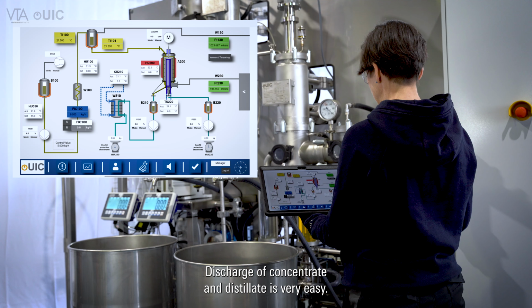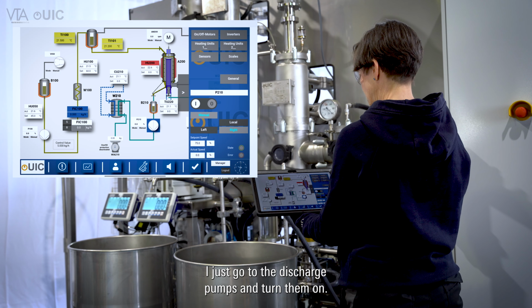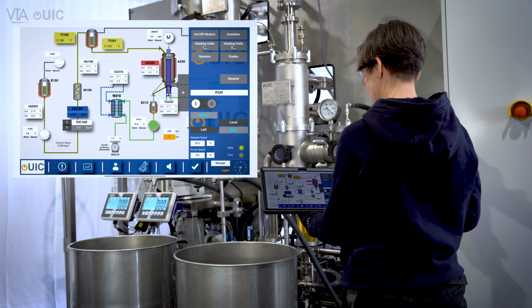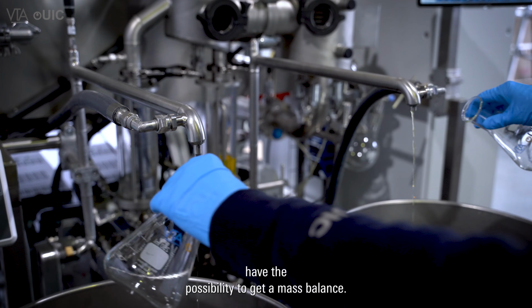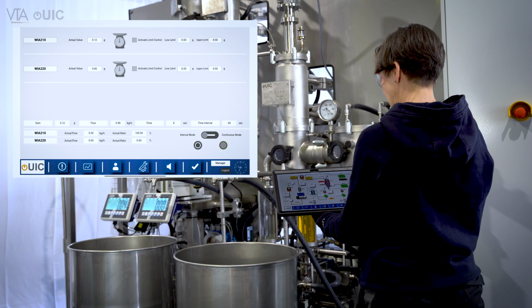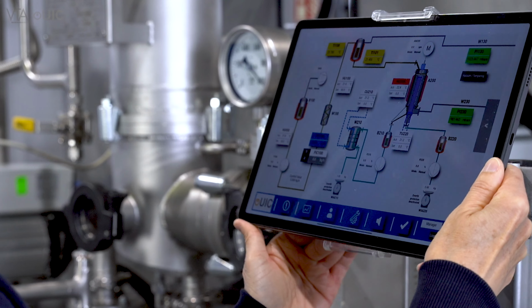Discharge of concentrate and distillate is very easy. I just go to the discharge pumps and turn them on. I also have the possibility to get a mass balance. As you can see, we have balances displayed here, and I can define that a mass balance should be calculated.